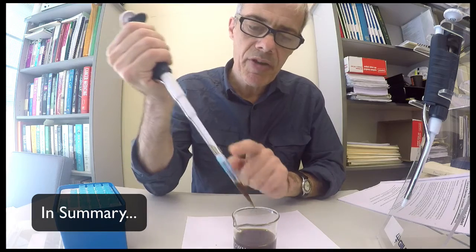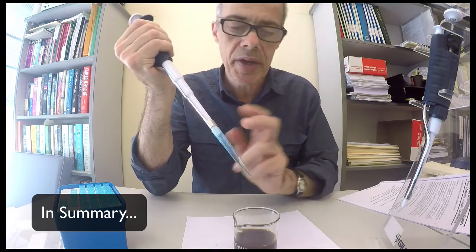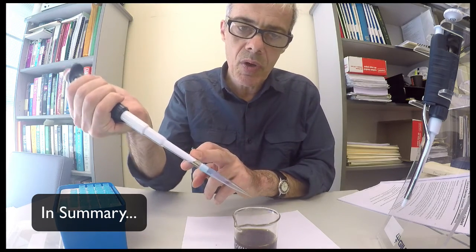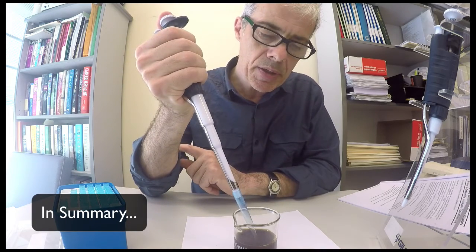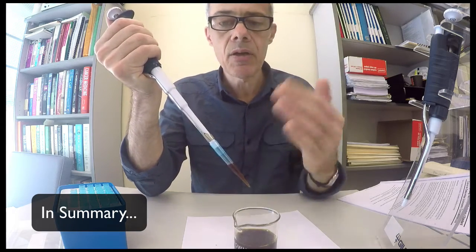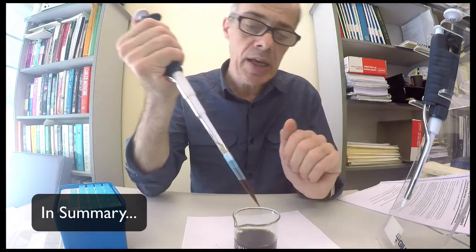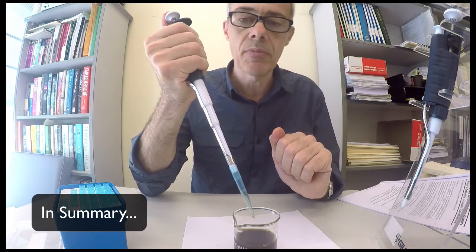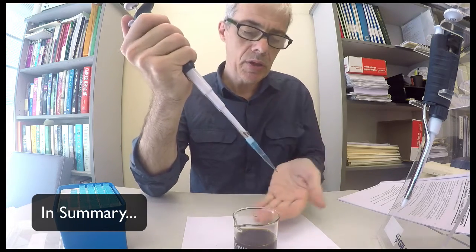You slowly draw up your solution. I've got a bit of air in there so I'll just dispense that out, and I'll pay more attention to the solution and not the camera. So I go down to the first stop on the pipette here. I then immerse and slowly draw up the solution. I then go to the other thing I'm dispensing into and I dispense the solution into that.